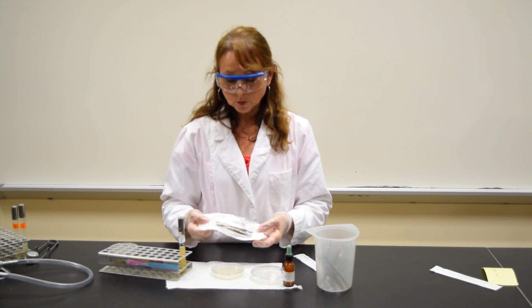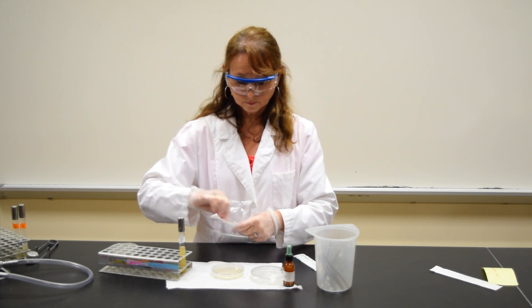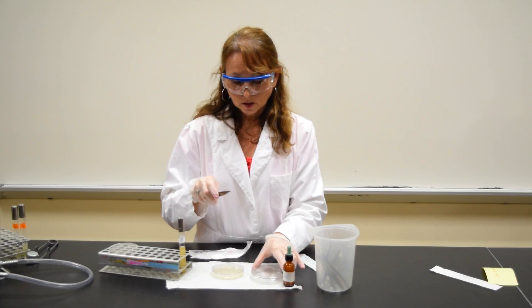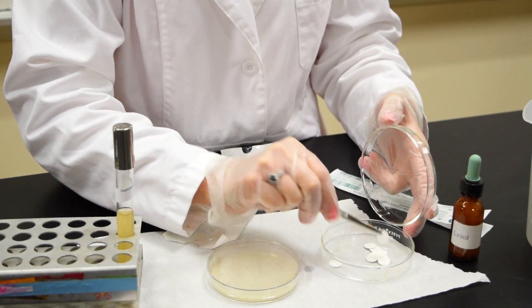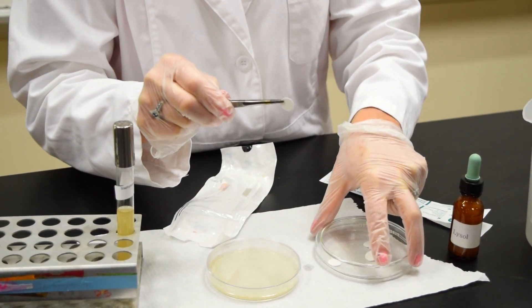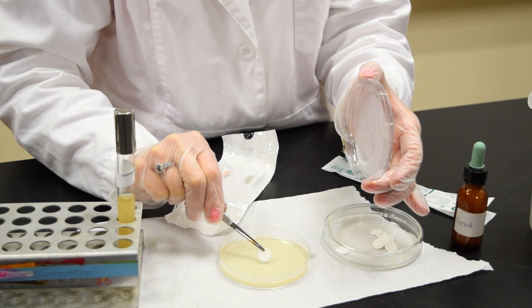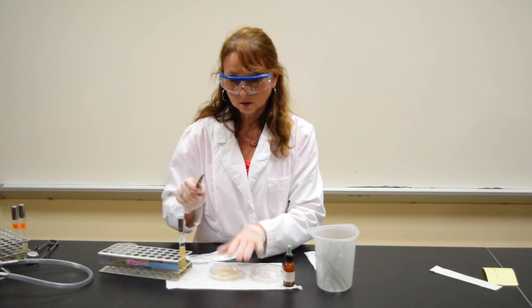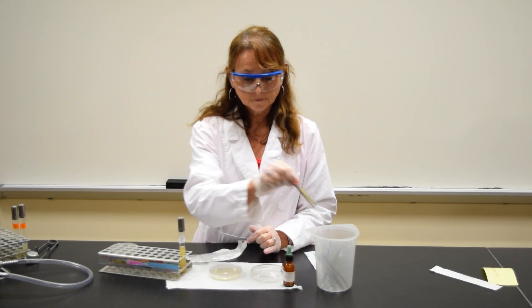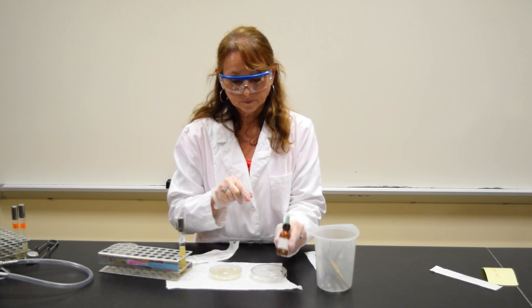Then, using forceps that are sterile, I'm going to remove a sterile filter pad and put it into the center of the plate. Place the forceps in the proper receptacle.